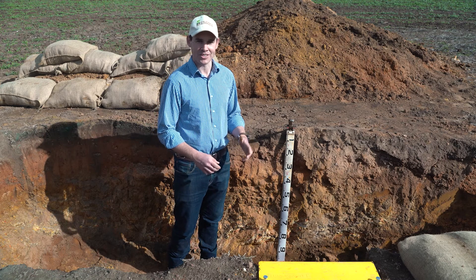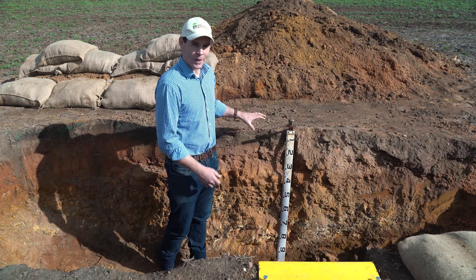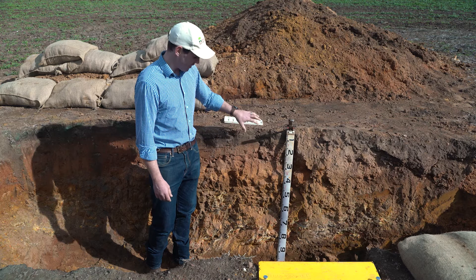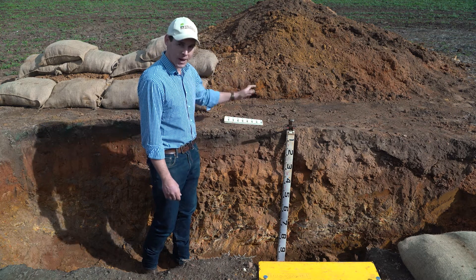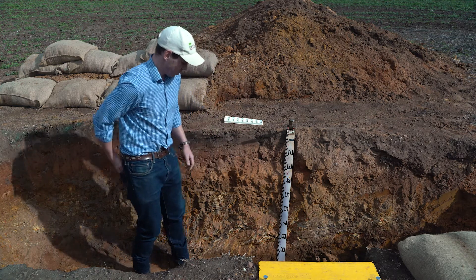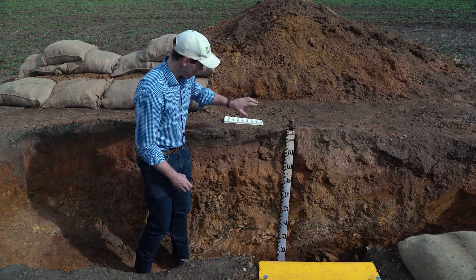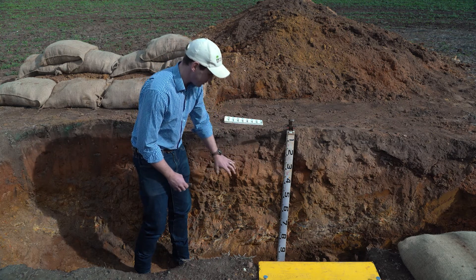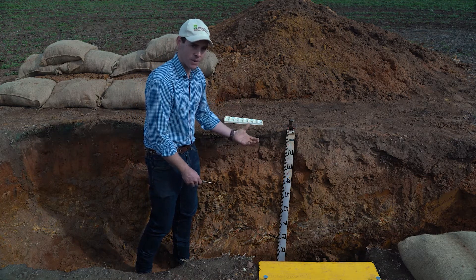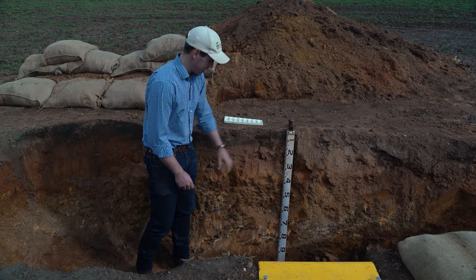Welcome to Soil Science Australia videos on identifying soils using field techniques. Today we're going to be running through identifying the soil pH down through your soil profile. Here we are at this soil profile in Tonkillo in the Adelaide Hills on a mixed cropping and pasture property. We want to select samples from individual layers to identify any changes in pH, which is a really important measure of nutrient availability, biological activity, and overall potential restrictions in your soil profile.